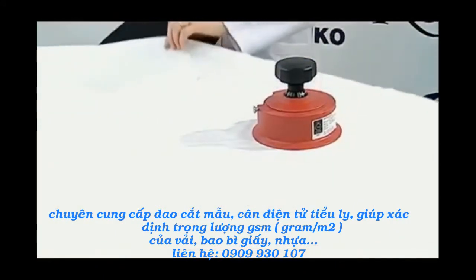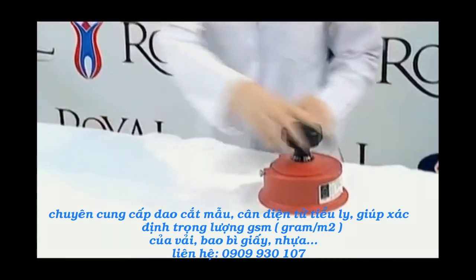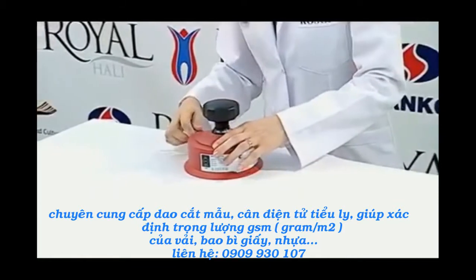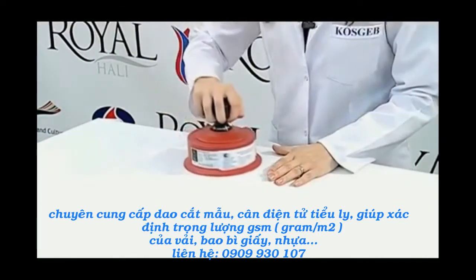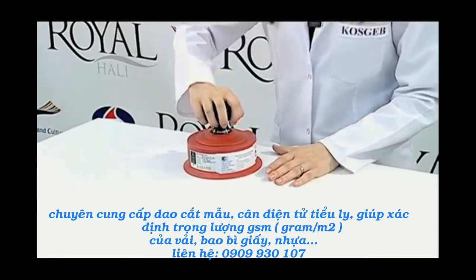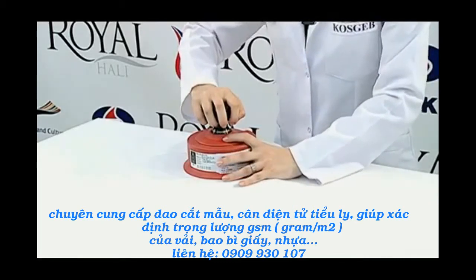When performing the test, the cork plate is placed under the point that we want to cut from. Then, the sample cutter is placed on it. We open the sample cutter's pin like that. First, we straighten the fabric like this. Then, we hold the arm with one hand and tighten the sample holder with the other hand.